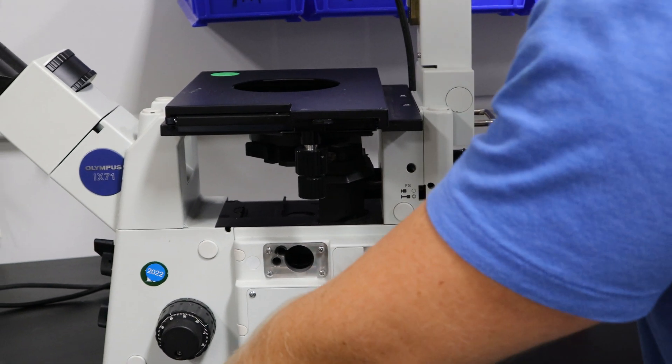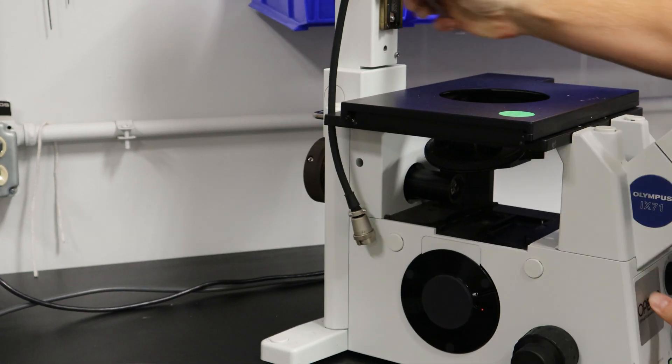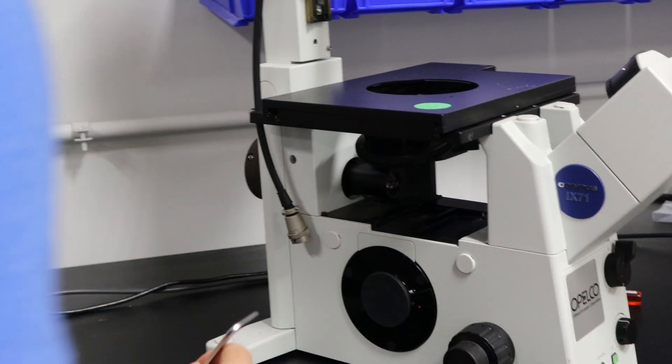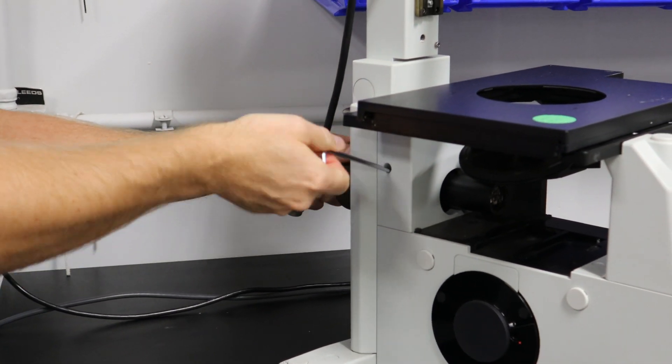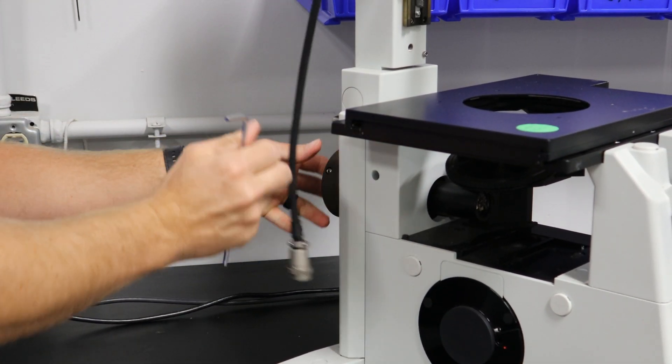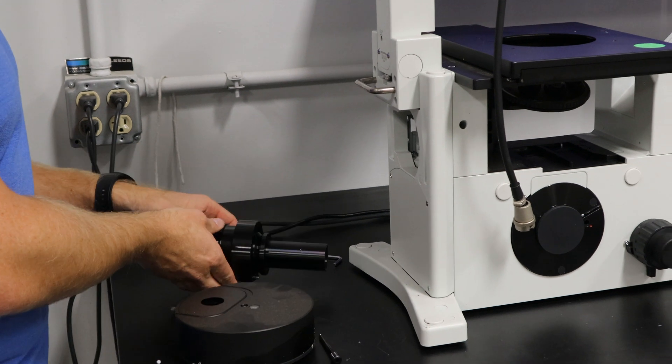It'll just screw right out. Then on the other side here, there's going to be another hole, four millimeters. Just loosen it up, and then it'll pull right out.